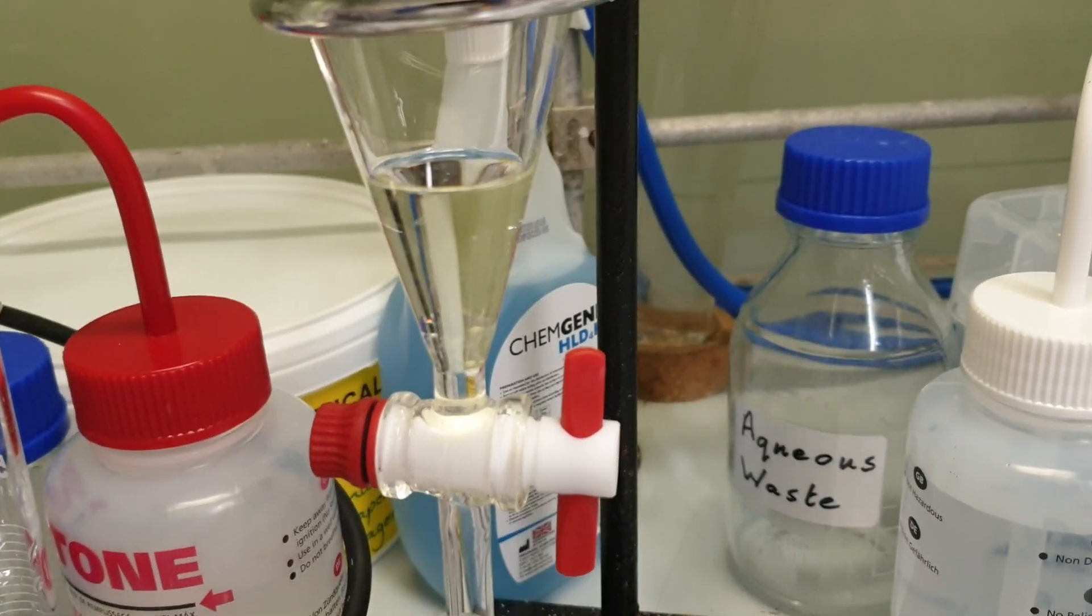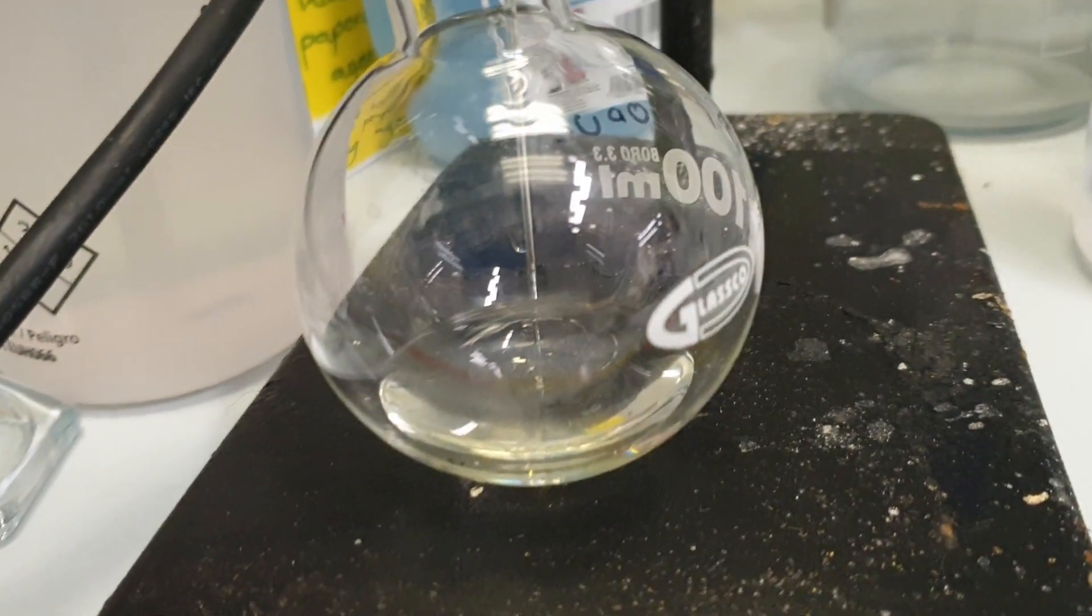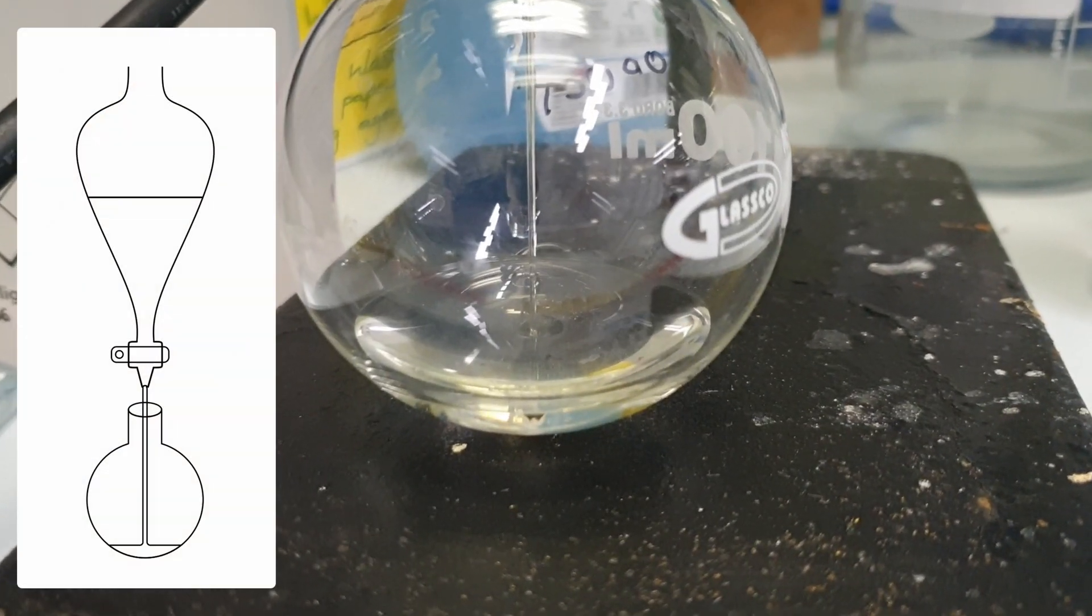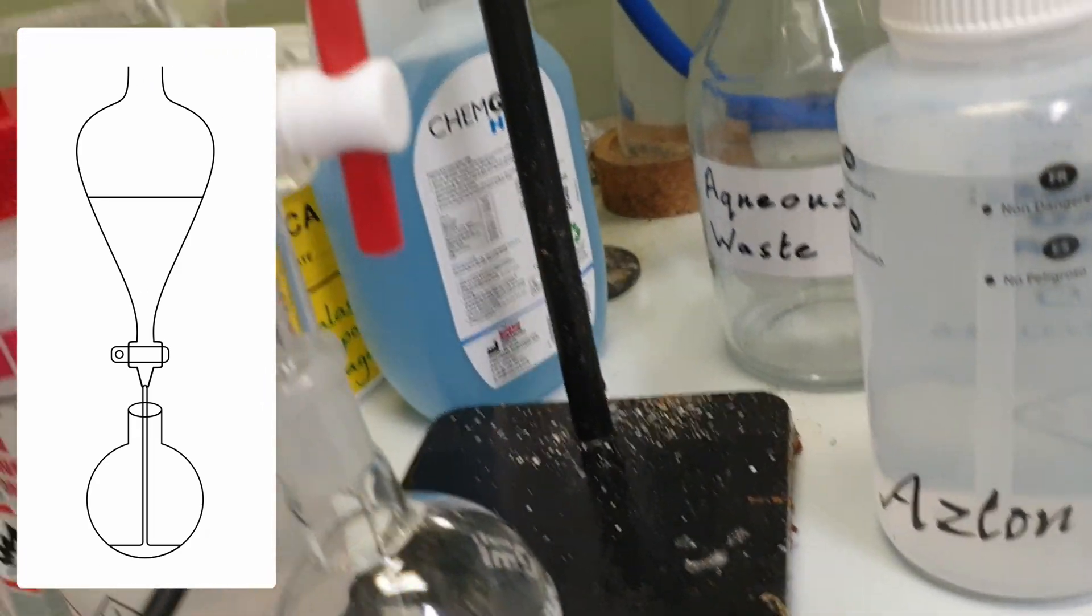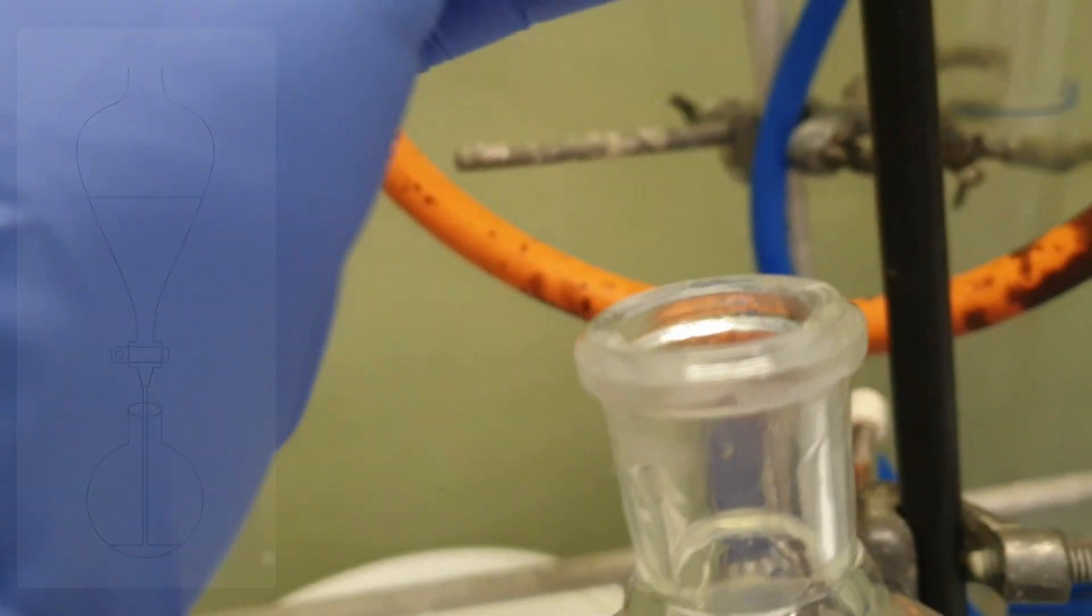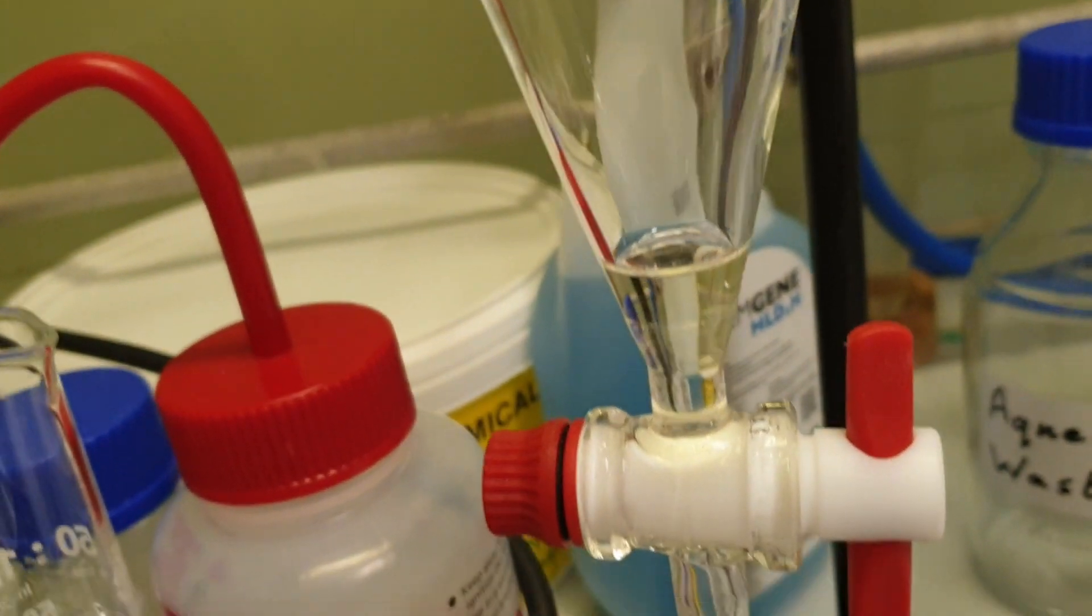Here I am dispensing my reaction mixture into my round bottom reaction vessel or reaction flask. Did I remember to move the stopper from the separatory funnel? It looks like I did, excellent.